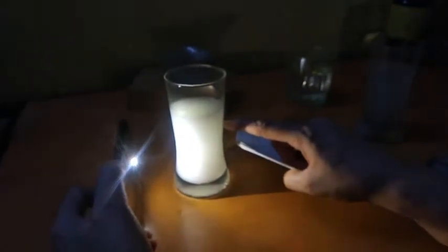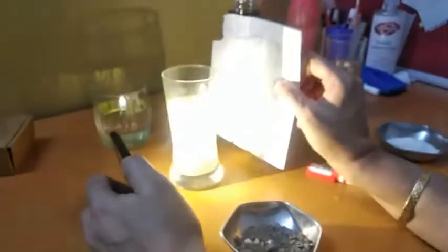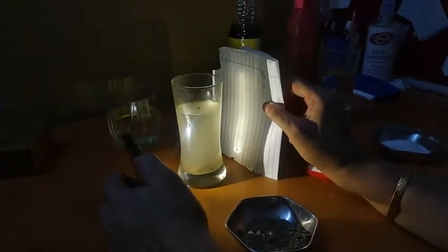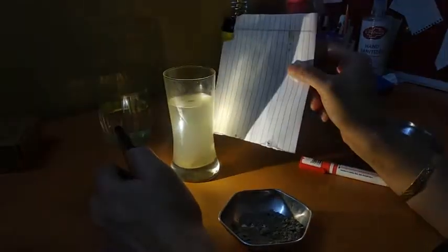So this scattering of a beam of light is known as Tyndall effect, and this scattering is there in the particles inside the milk. Okay, now the same way if I do the Tyndall effect here, just see the light pass through it. Some amount of light is visible here on the paper. So light is passed through. The reason is here some of the lighter particles are suspended. So sometimes even the suspension also shows Tyndall effect. It all depends upon the size of the fine particles.